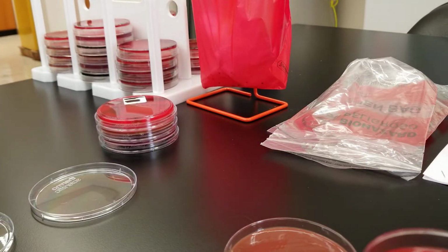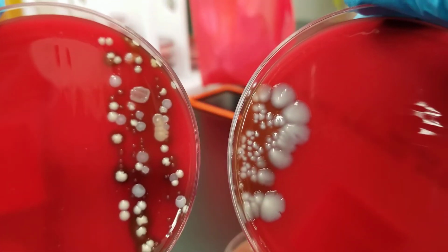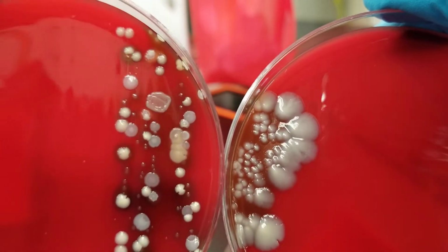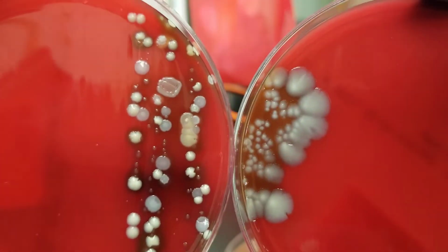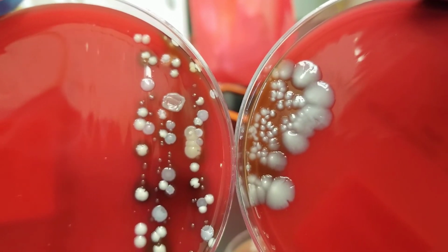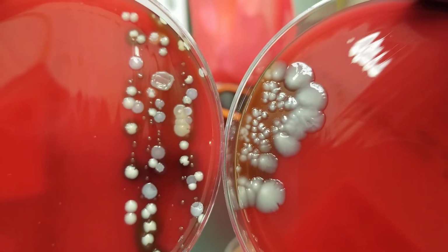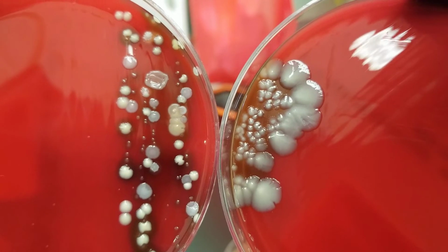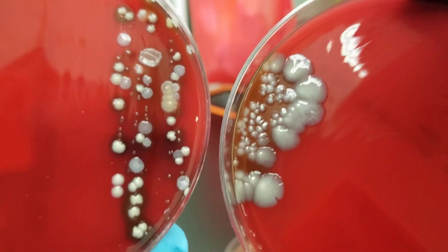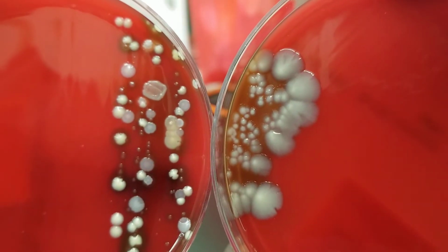And looking at the difference here, this is the nasal from earlier, the MRSA. You can see that even under the microscope, gram-negative rods, or rods in general, are larger than cocci anyway. And so here's a difference showing you what they look like on a culture plate. The ones on the left would be gram-positive cocci, and then the one on the right is a gram-negative rod, and I'm showing you here the difference in size, okay?